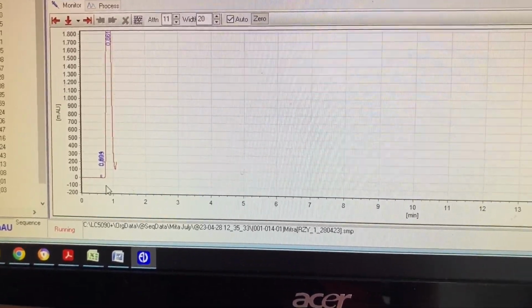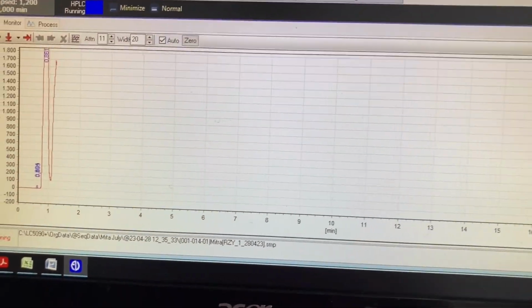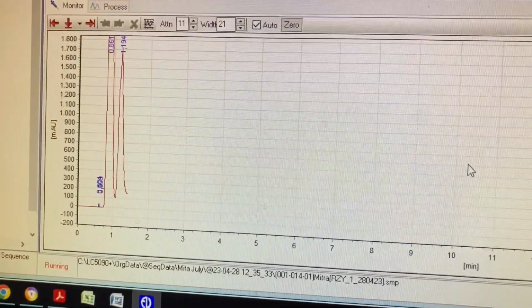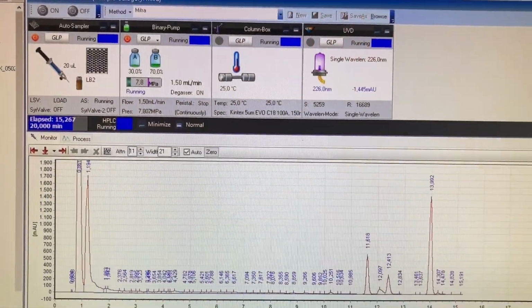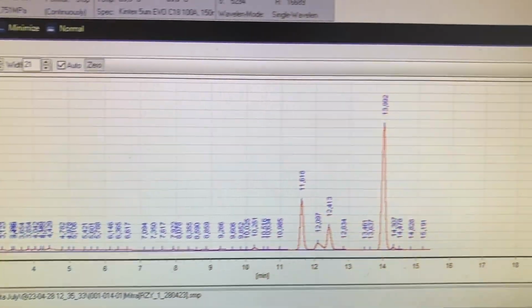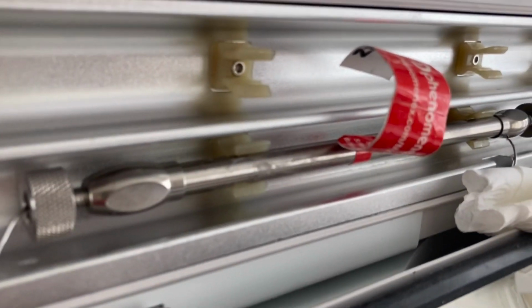It should be detecting the mitragynine around 14. I increase this to 21, because the run finishes in 20 minutes. Everything's good so far. Good, so it's running well. I've got it running at a slightly lower pressure. It's found the mitragynine peak there, which is a nice high peak by the looks of it. It's over 1.5. And it's not leaking. Fantastic.